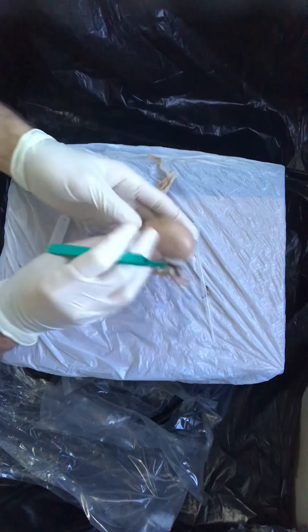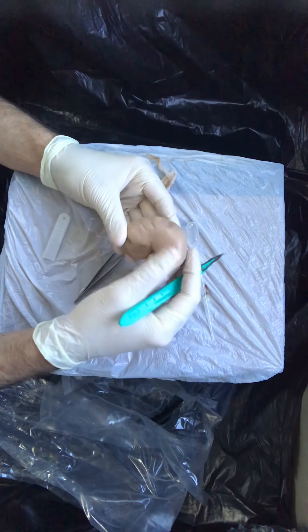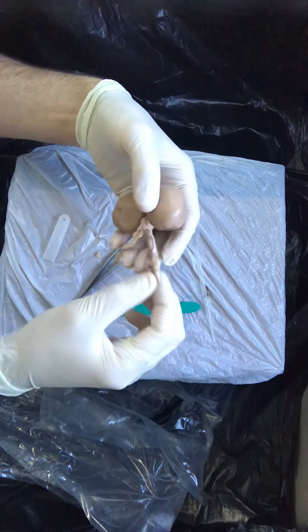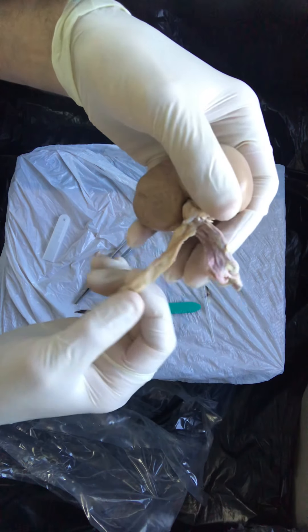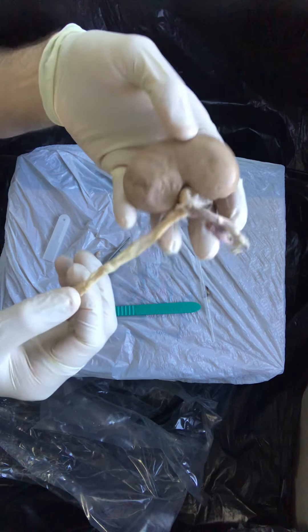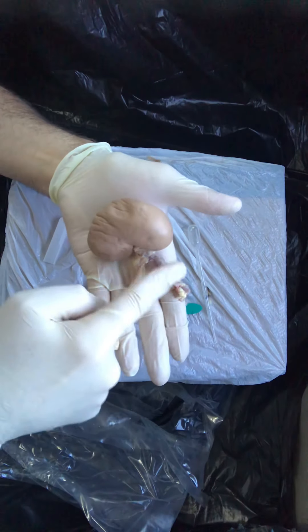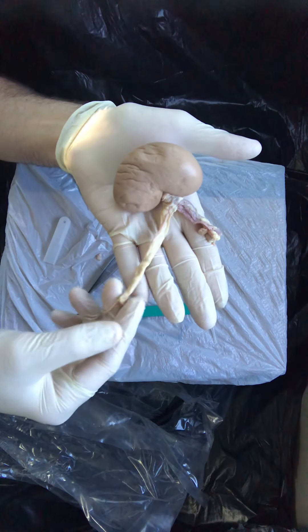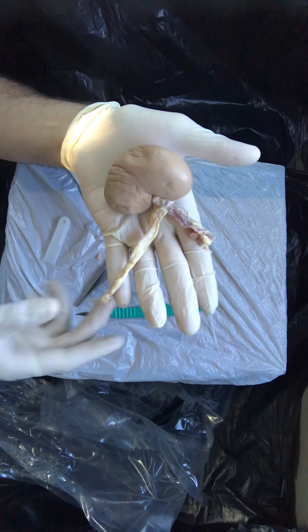The kidney itself is not frankly that exciting to look at from the outside. It's very homogeneous and uniform in color. As you're looking at these structures — the artery and the vein at this stage, before we do anything — they're going to be a little bit hard to see. But the thing that I think on most of your specimens will be pretty easy to distinguish is we've got blood vessels here, laying across my pointer finger, and then we've got this thing that's sort of encased in a little bit of fat. It's probably longer on your specimen, and it's probably a little bit lighter in color. This is going to be the ureter.